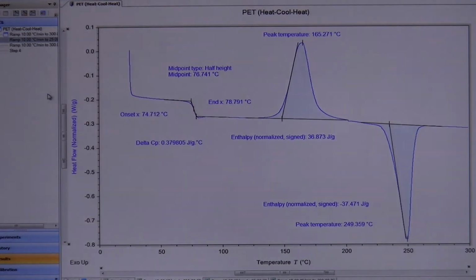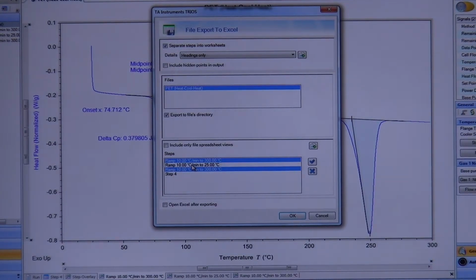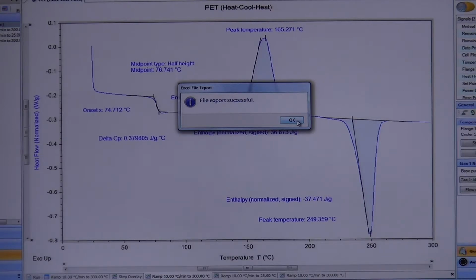If you want the raw data, for example, if you don't have TRIOS as yet, you go to the actual file, you right-click, you say export, and you can either export it as text or Excel. Most people would probably prefer Excel. So you click on that, and in the Excel menu here, you can select or deselect which steps you actually care about. In this case, I want all of the data, so I want all 3 steps. The last step is typically empty, so you don't have to copy that. You select which ones you want, you hit OK. It will basically build the Excel spreadsheet. It'll say that the file export is successful.